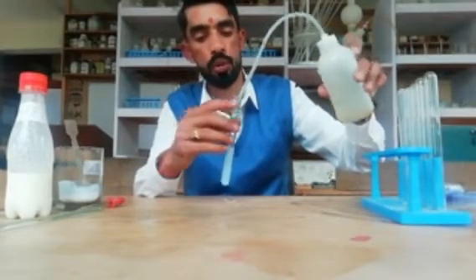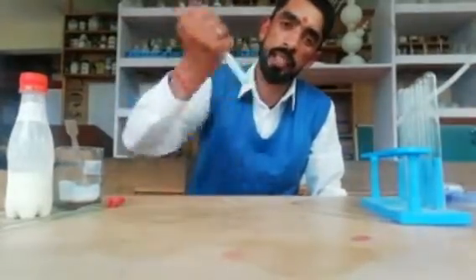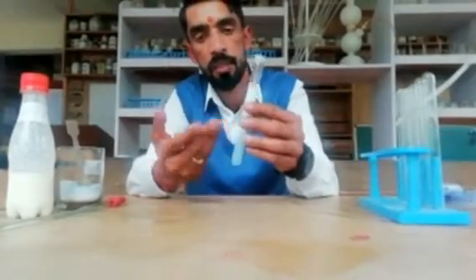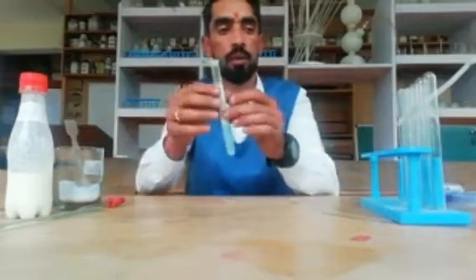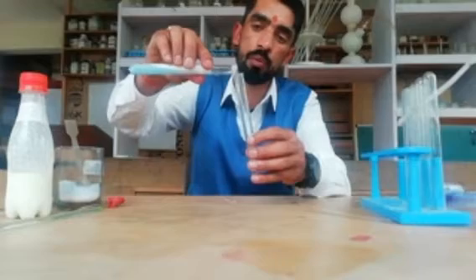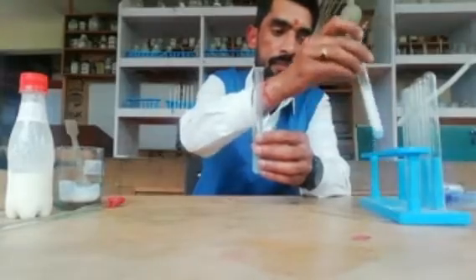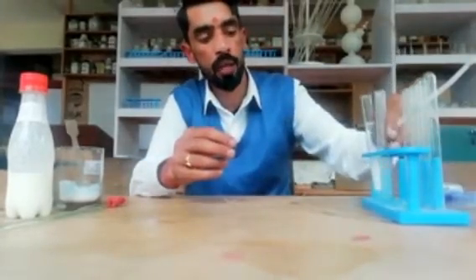We need to make the solution by shaking it properly. You can see this is the nature of washing soda — it is giving a milky appearance. One by one we are going to take this solution into test tubes. We have three samples, so we will take three test tubes. This is sample one and sample two.